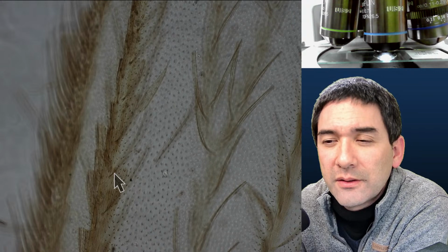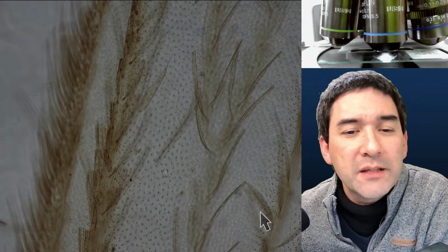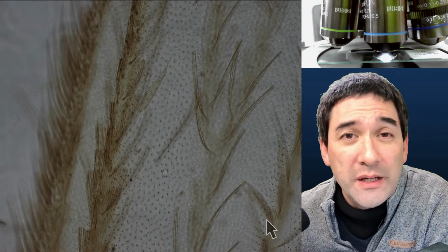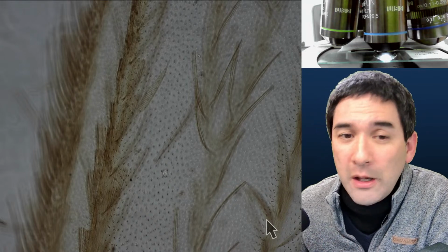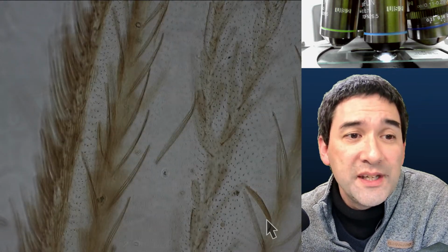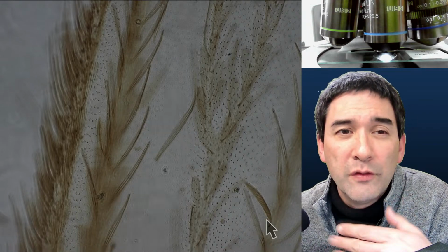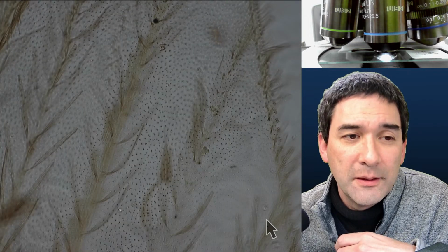Okay, so what's the function of the scales? Yeah, that's the question here. I also ask myself the same question. Of course, it could be sensory cells connected to them to sense maybe the airflow. But again, I think this probably has something to do with the aerodynamics. Yeah, it increases the resistance, and maybe this way they're able to move a little bit more air when they're beating the wings. Yeah, I speculate.